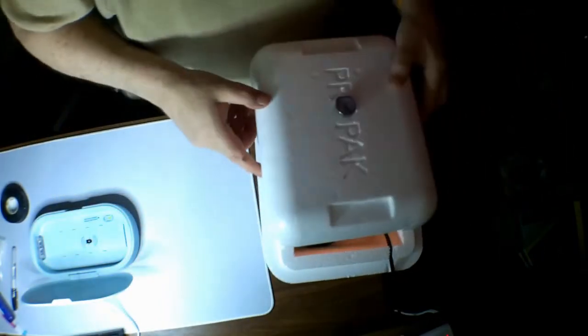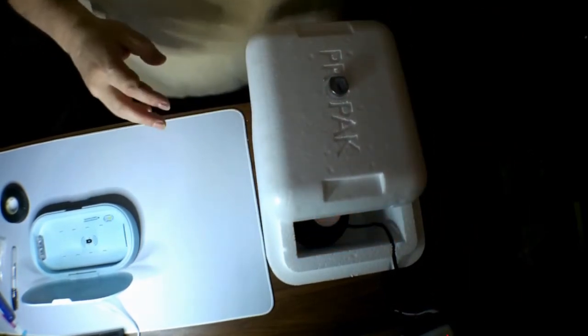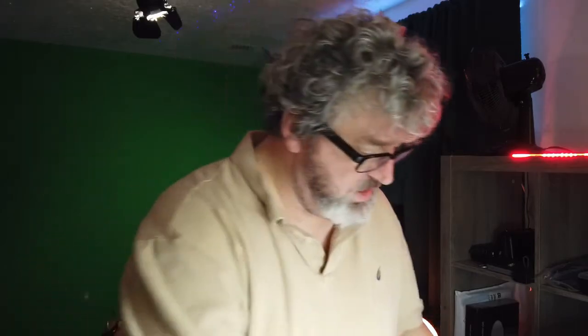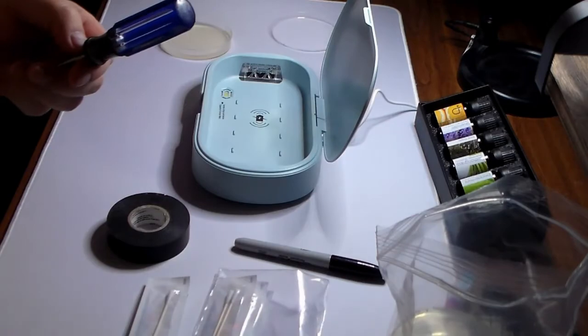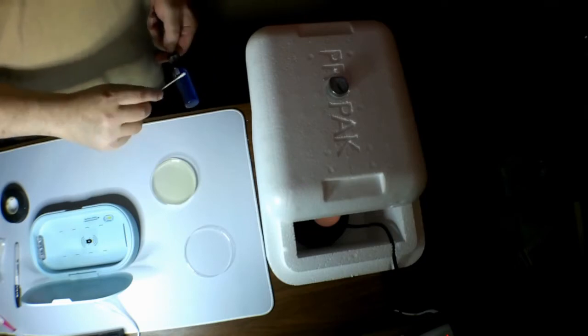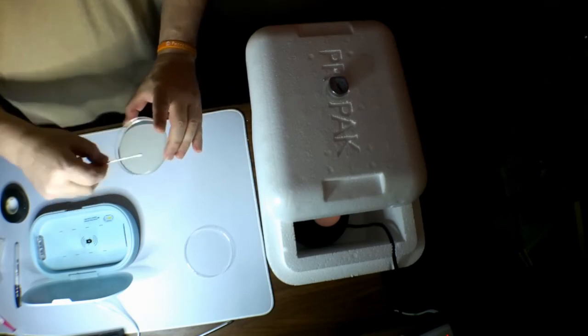I think I'm going to turn the temp down until we're done putting all the stuff in there. Well, I have the essential oil in there. Let's go ahead and do the screwdriver next. So we have agar, okay, screwdriver's next. So I have a moistened swab, all right, we have S1 completed.